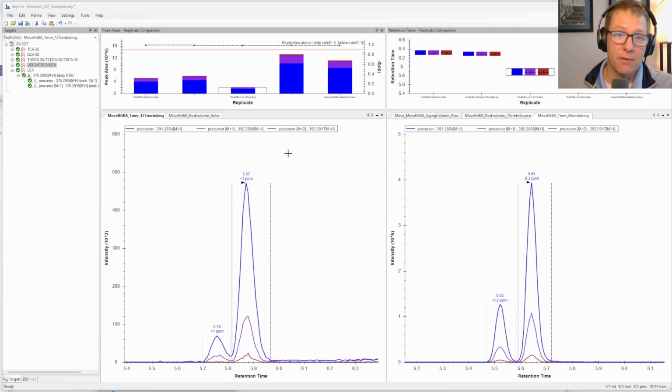So on the left, we have 75 centimeters of five thousandths ID or 127 micron tubing. And on the right, we have 75 centimeters of 0.0025, the beige PEEK instead of the red PEEK, inner diameter tubing. So half the diameter results in fourfold less post-column broadening. And so this example just highlights the importance of only the post-column connection.